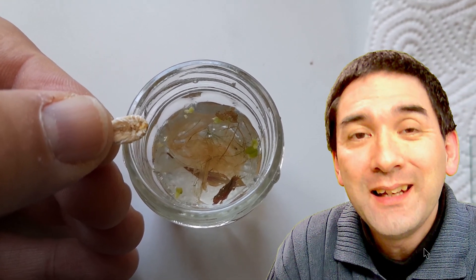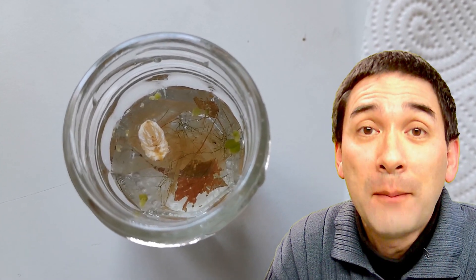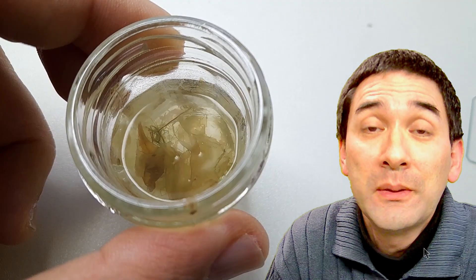I added a crushed cereal grain or wheat grain, oats, to the water sample and then I let it stand for approximately one week.